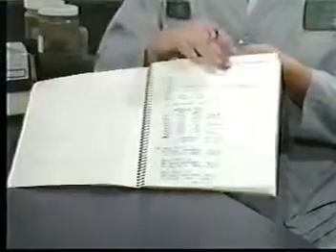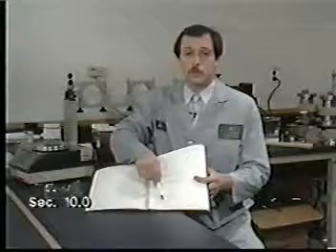There are a number of quality assurance practices to observe for both the ZHE and bottle versions of the TCLP. Maintain records of all data for inspection. A blank should be run for every 10 extractions to check for possible contamination and to ensure that the equipment is functioning correctly. After the extract has been produced, it is recommended that for every batch of up to 20 samples, a matrix spike be performed.